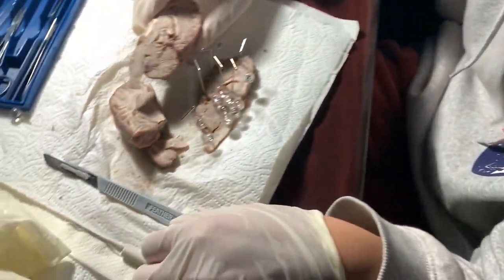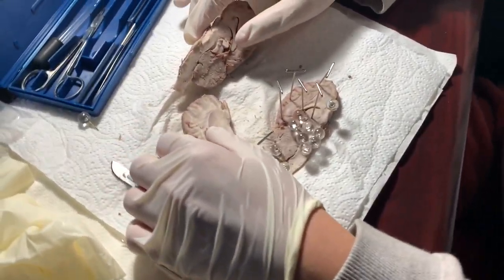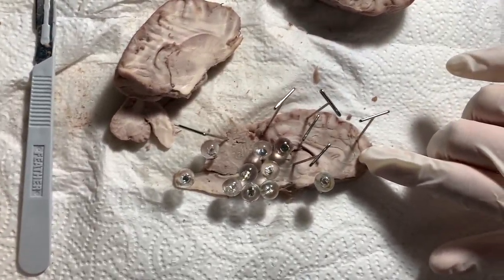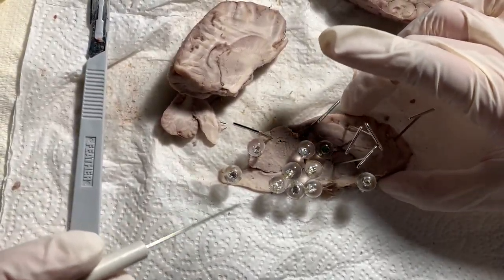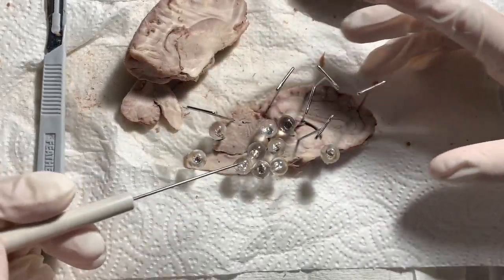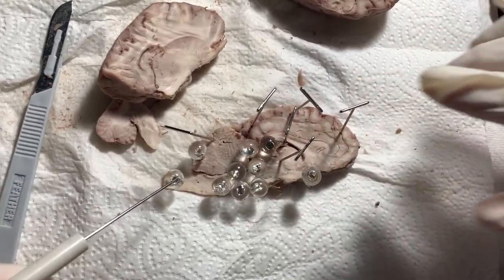Good evening class. Today I will be discussing the sheep dissection for course 4353, which is Physiological Psychology. I have already went ahead and dissected the sheep's brain into sagittal form. I will be pinpointing with the parasagittal portion of the brain so that I can talk about the different portions of the brain.